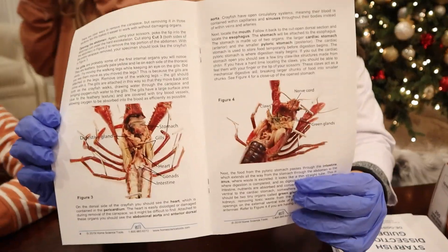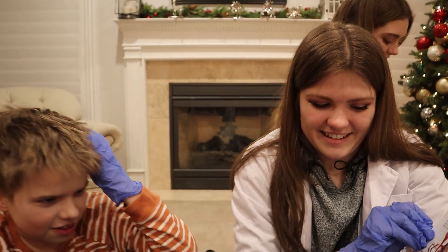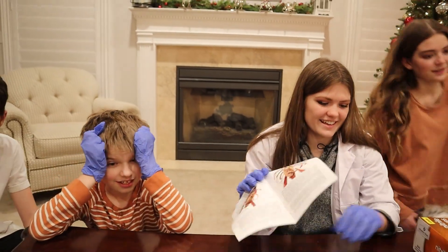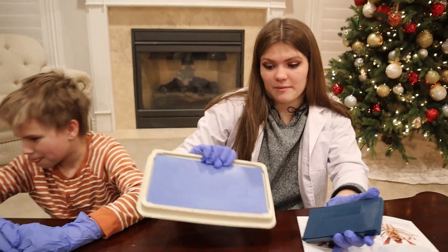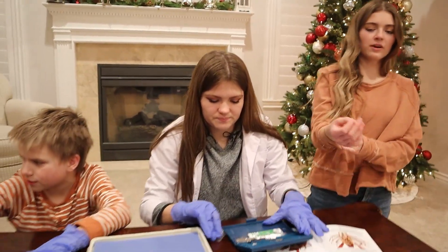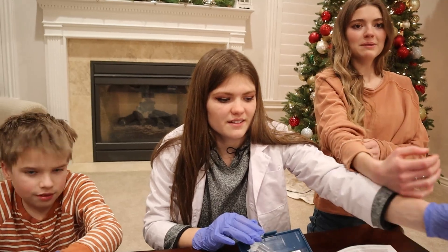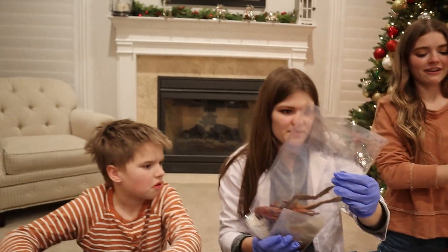The picture's in here — oh no! All right kids, let's do this! Grab your gloves! Smelling this plate brings me back squid vibes. To be completely honest, I'm terrified. I've only ever dissected one thing and it was very nasty. I made my partner do most of the work and I was the scribe. Let's open this up — I'm a little petrified.